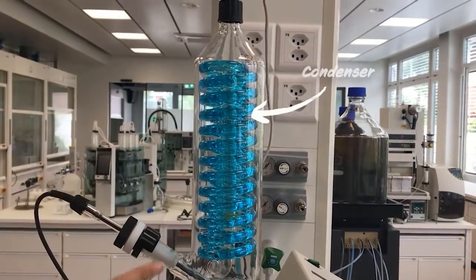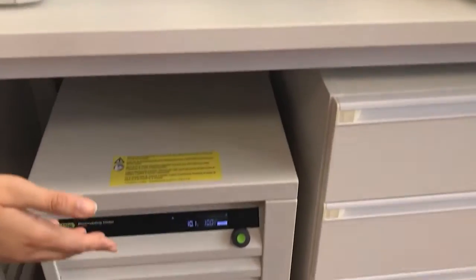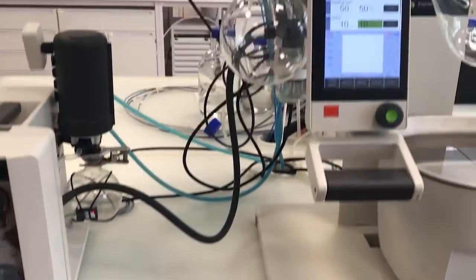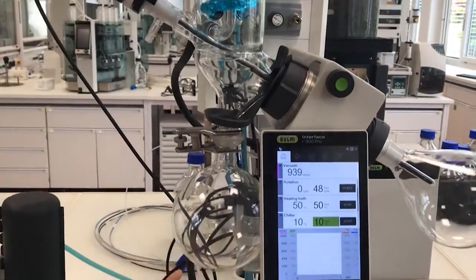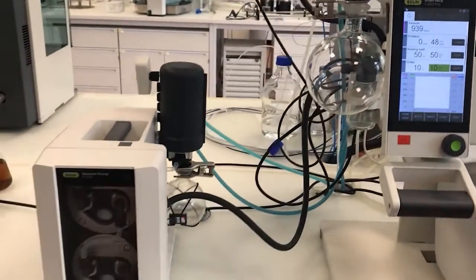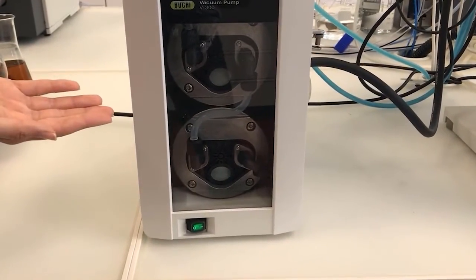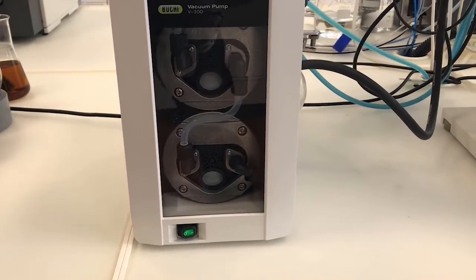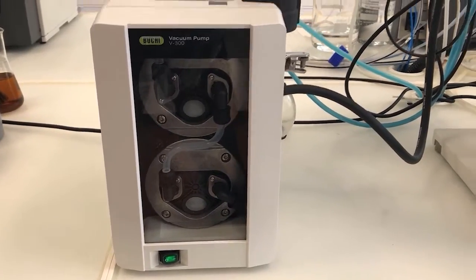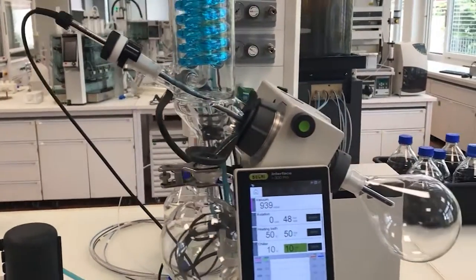The condensation area is cooled by a chiller or by means of tap water. The distillate will then be collected into the receiving flask. To reduce the pressure inside the system, one needs a vacuum source. Here we have a vacuum pump that allows evaporation at a reduced boiling point and pulls the vapor into the condensation area.